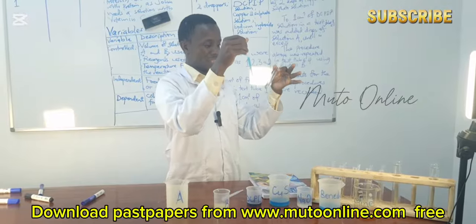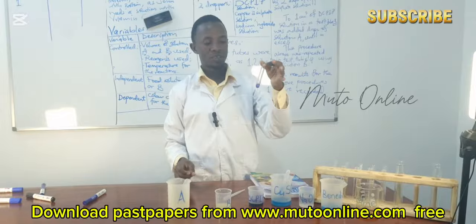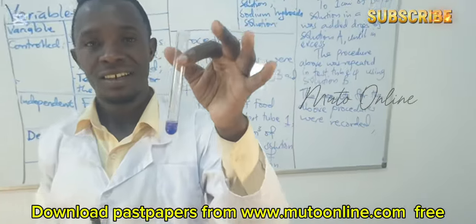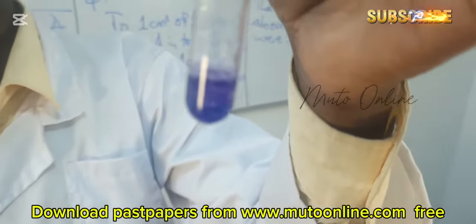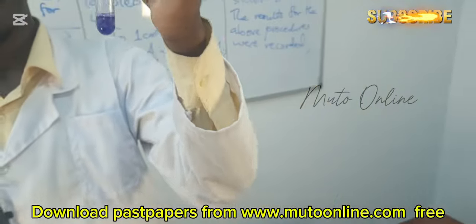So we are checking whether this substance contains proteins. If the solution turns to purple or violet, it is an indication that the solution contains proteins.